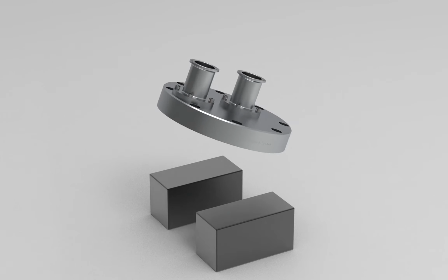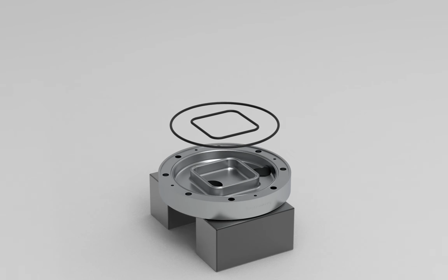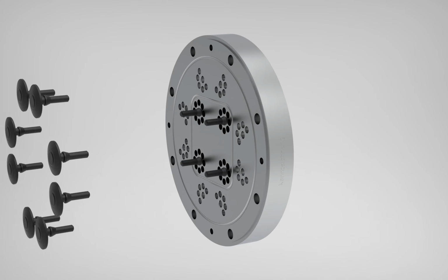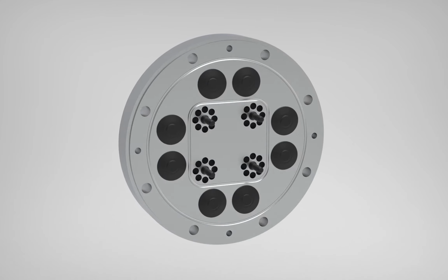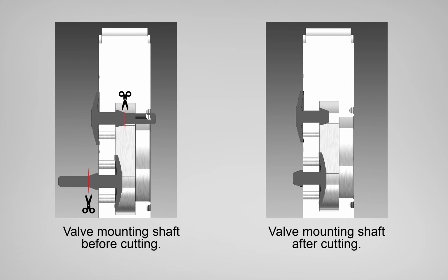Flip the pump housing including the connector ports. Mount the new O-ring and profile O-ring. Mount the valves on both sides of the valve plate. Use pliers to pull the mounting shaft of the valve through the valve plate on both sides. Cut off the valve mounting shaft with a side cutter at the marked position on the valve once inserted through the valve plate.